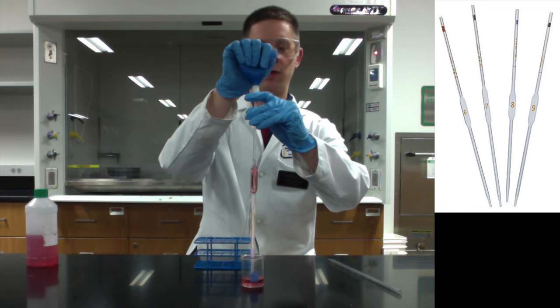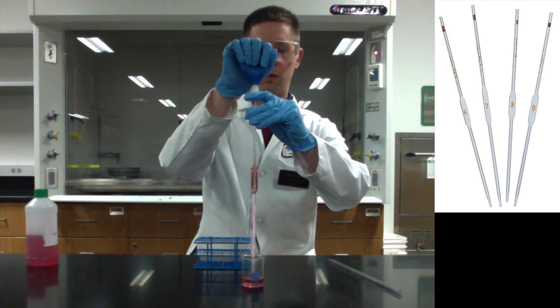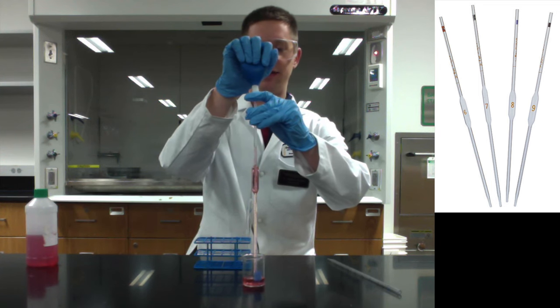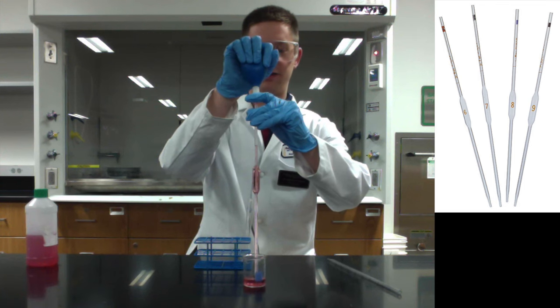Now, here's the tricky part. Where do we go from here as we're filling up? Well, we're just about to hit the line, and as soon as we hit it, you might think, okay, now I need to move the pipette over the test tube, right? Transfer it. Wrong.